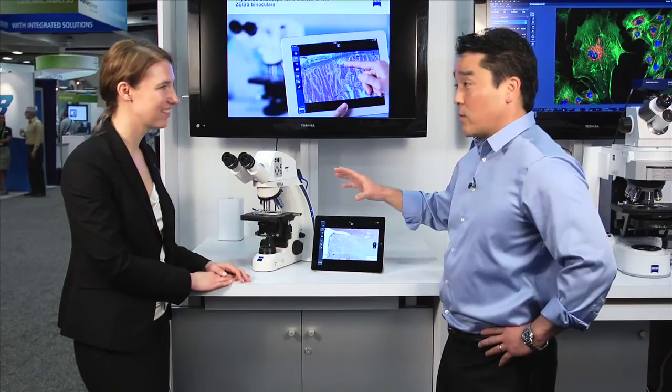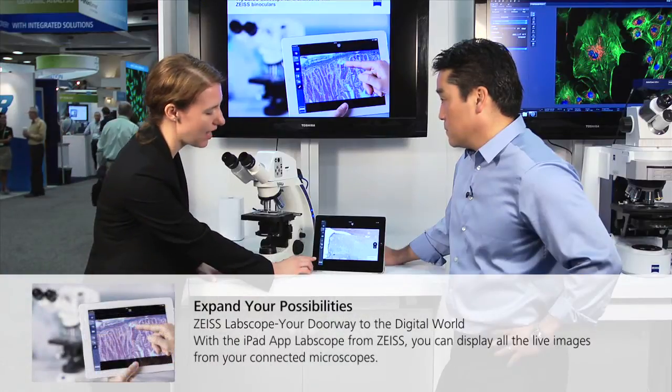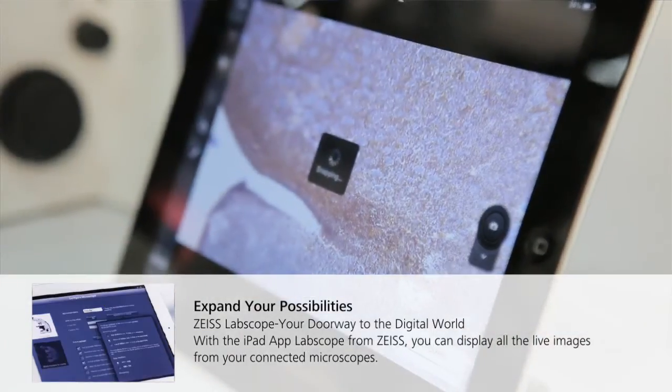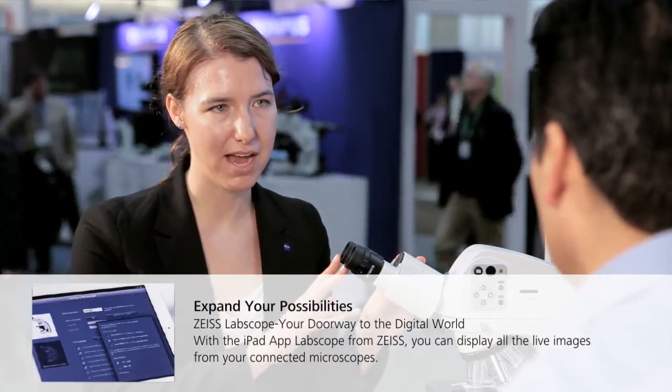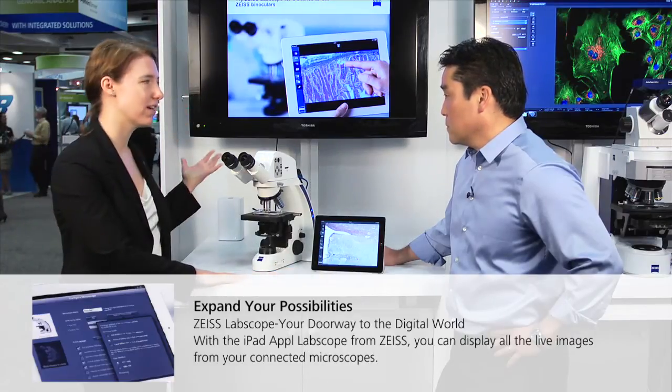So you've been developing microscopes for the classroom for a while. What are some of the new features in the PrimoStar HD? What's cool about the PrimoStar is students will still be able to learn all the basics of microscopy, but using this new app they can very easily and quickly learn how to take images without having to learn a whole new software platform. They download the app directly to their own tablet and can quickly take their own images directly to their own devices. Additionally, the classroom experience is no longer limited to just what you see through the eyepieces — an instructor can connect directly to that student's microscope and then send that image to an overhead screen or projector to share with the entire classroom.